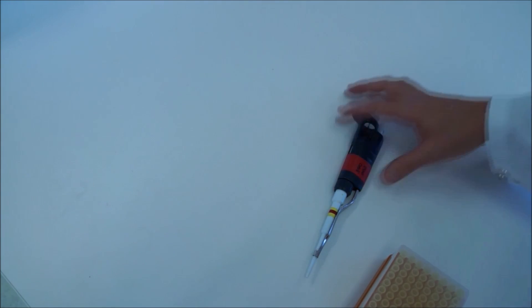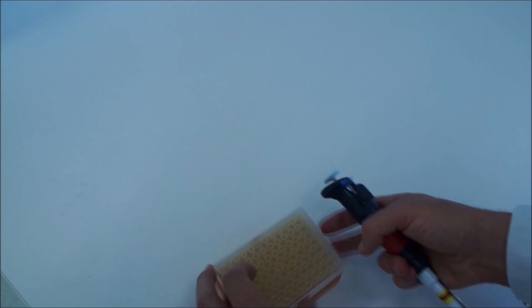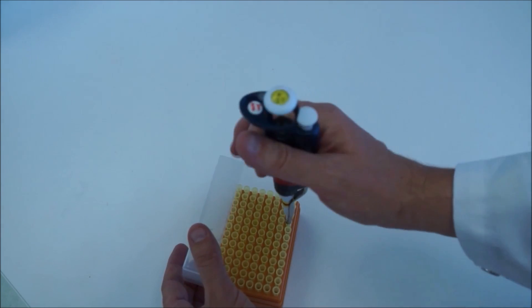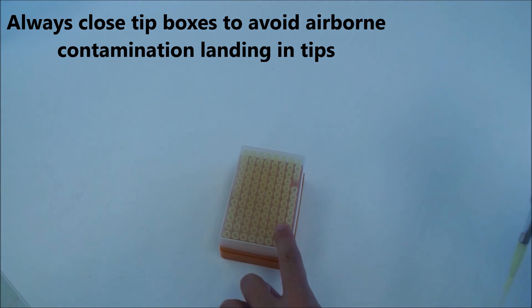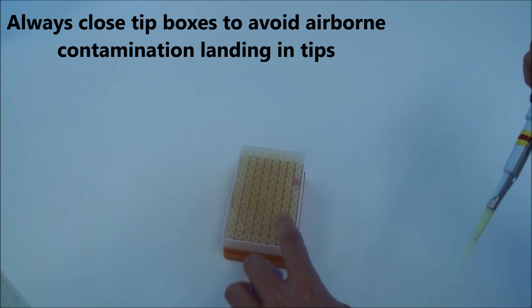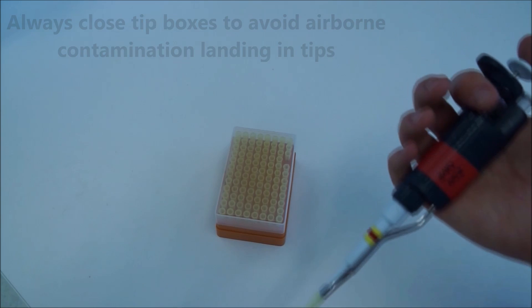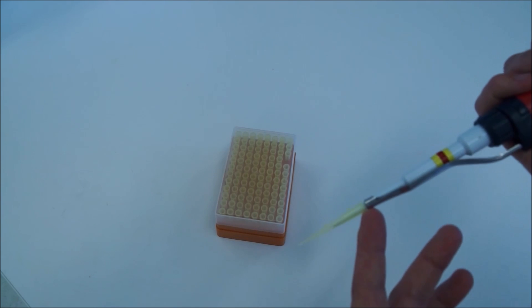So how do you use these? Well, open the box and just tap down. Make sure you always close these boxes because they may catch contamination from out of the air, or if you're talking, you may accidentally spit. Everyone does it. So there's the pipette tip.